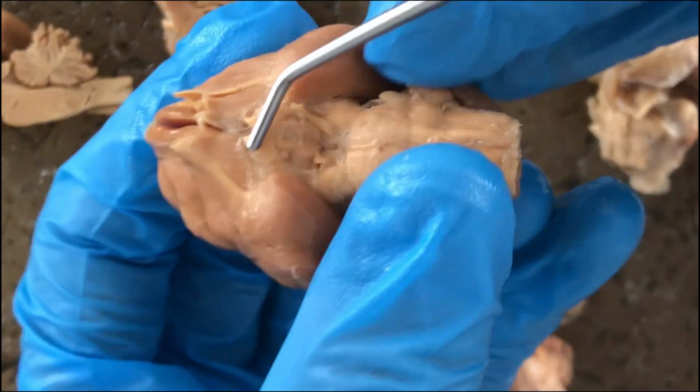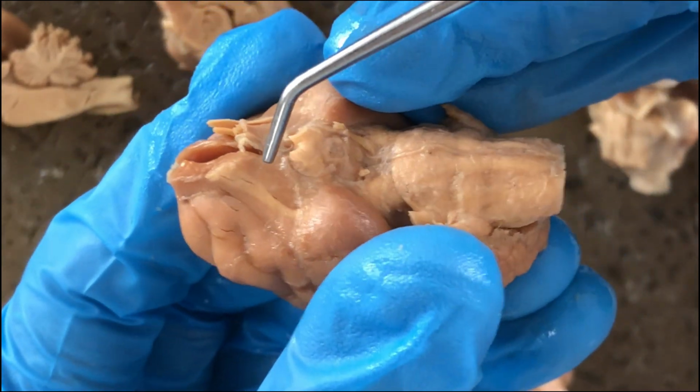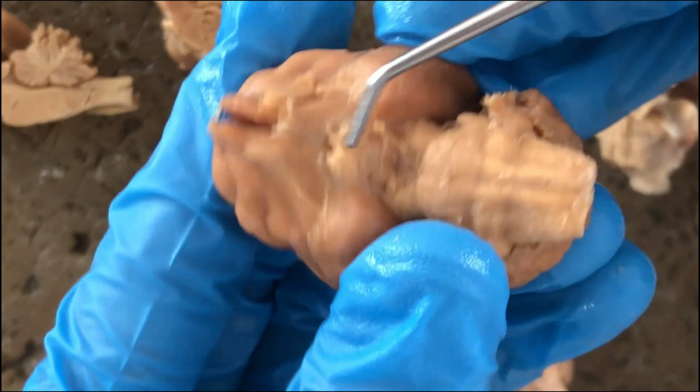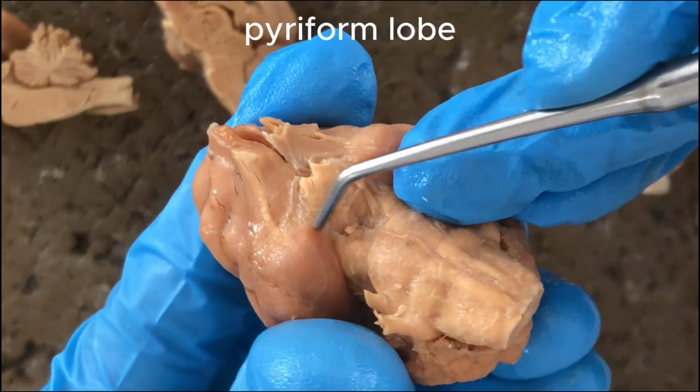And the olfactory bulbs will receive olfactory sensations from the olfactory nerve and deliver it via the olfactory tracts into a portion of the cerebral hemisphere called the piriform lobe.